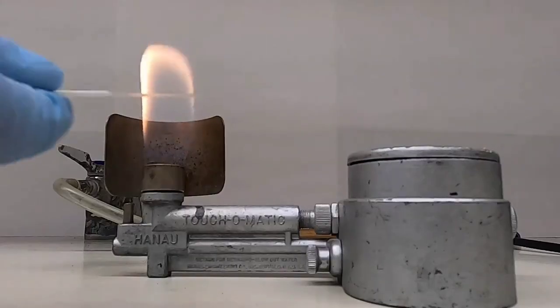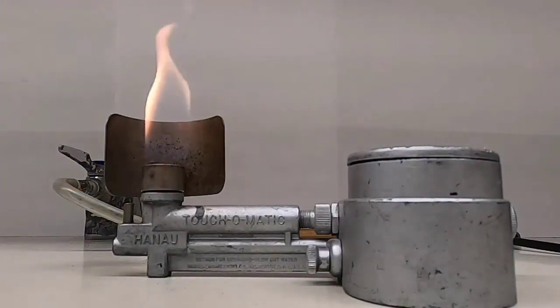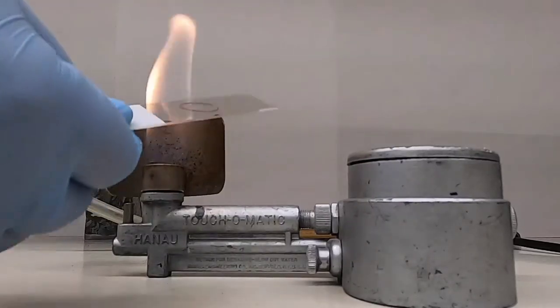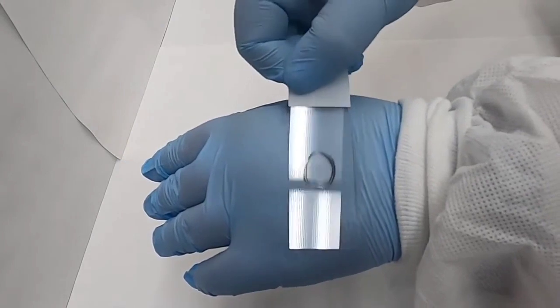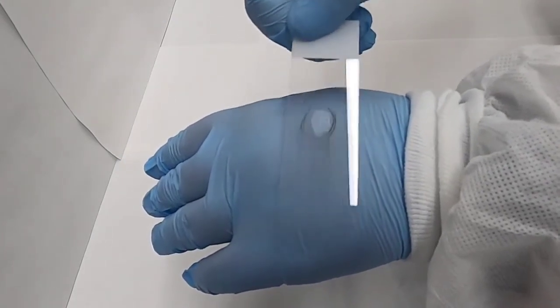The next step is to heat fix the slide by passing it through the flame several times. We are fixing it, not cooking the bacteria, so you want it to be warm to the touch but not overly hot.